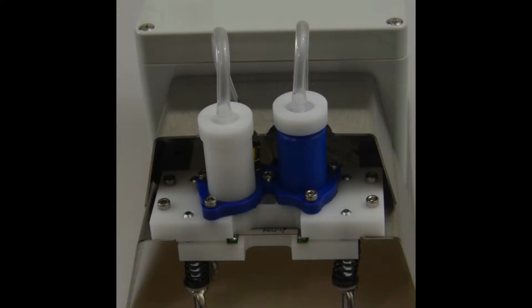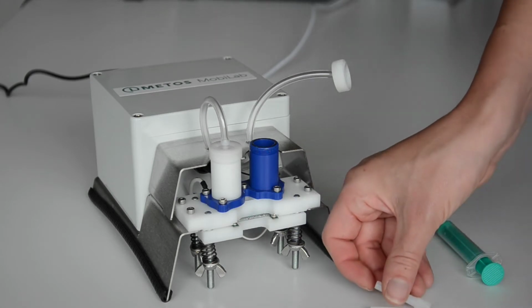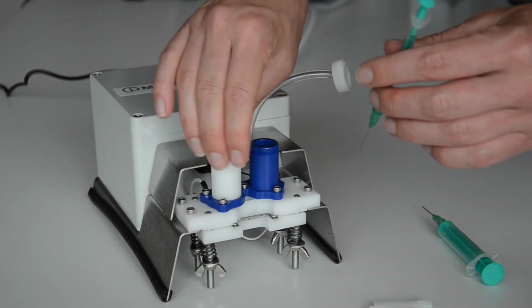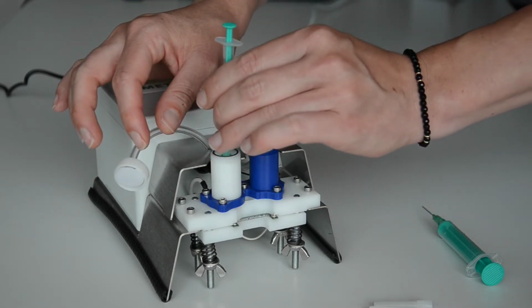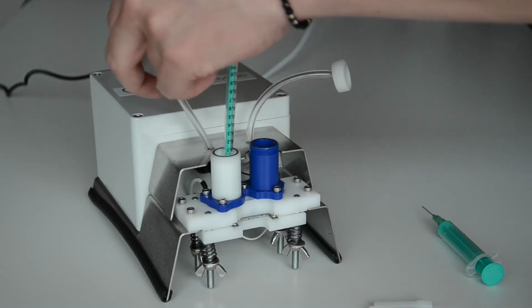To guarantee the connection between the two containers, any air bubbles in the small opening in the containers must be eliminated. Otherwise, the necessary electrical flow will be interrupted. To do this, open both containers, take the small syringe, position the tip directly into the small hole of the container and suck up a small amount of liquid to remove any air bubbles. Fill the absorbed liquid back into the container.